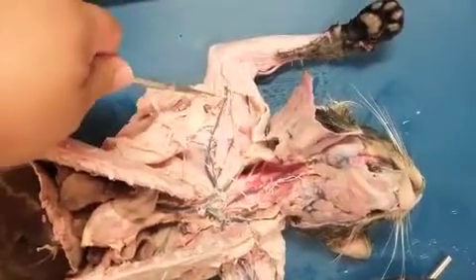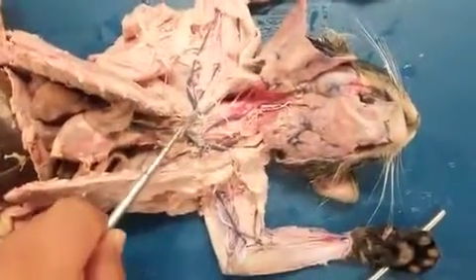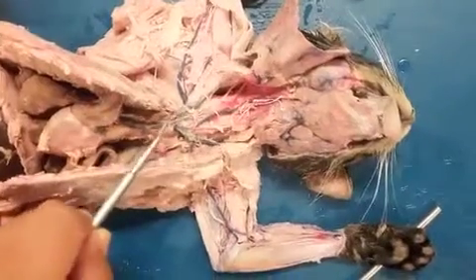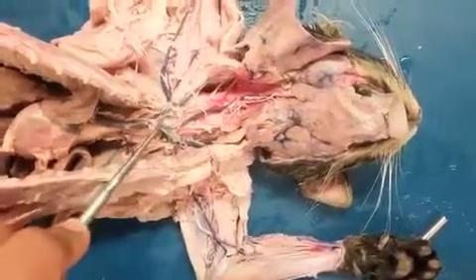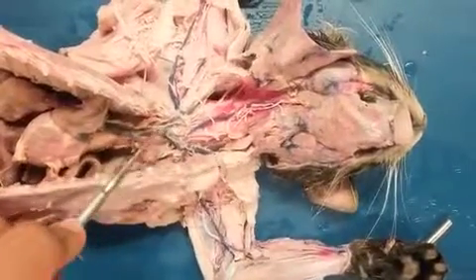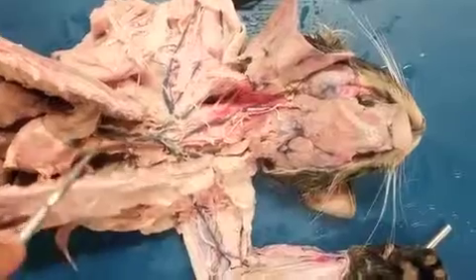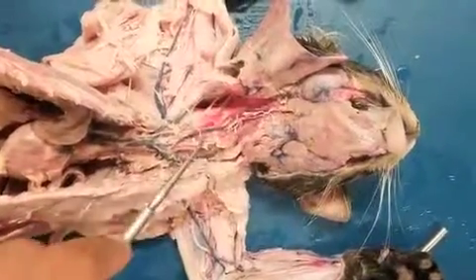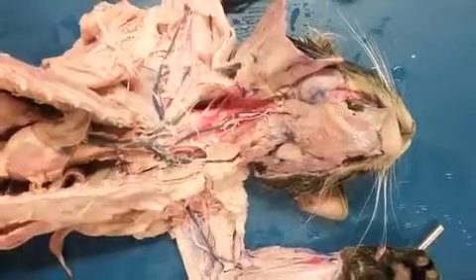As far as the vein, same thing. Brachial vein, axillary vein, right subclavian, very brief right here as it comes into the rib cage, and then brachiocephalic vein. And the two brachiocephalics then drain into the superior vena cava. As far as the external jugular, or the jugulars going up, becoming external and internal, that's where you want to see the pictures on the board.